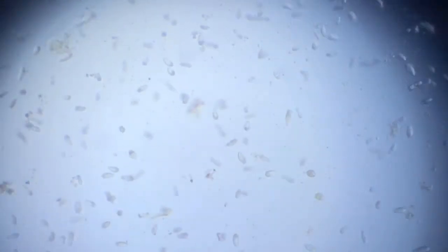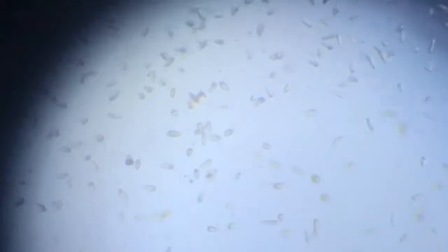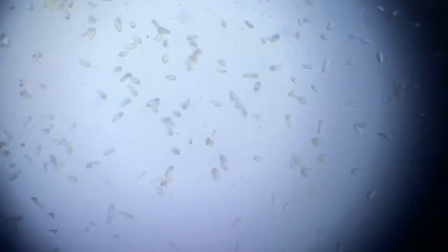These are just little, but I'm not very satisfied with the alignment. Now it's a little better, but I still need to move a bit more far and then bring it in approximation. A little bit more is required.